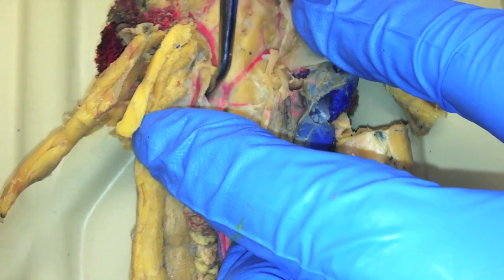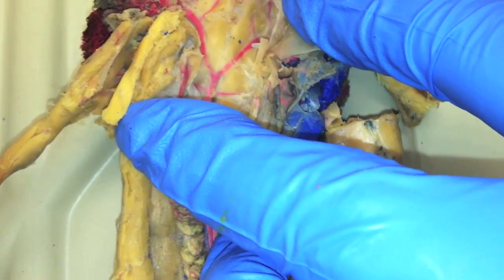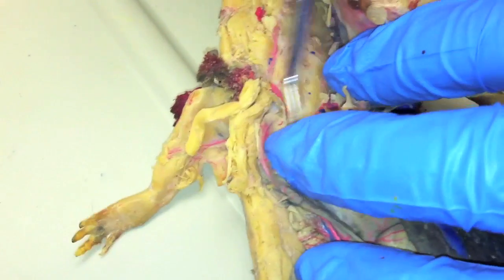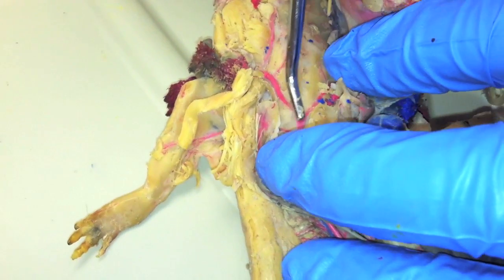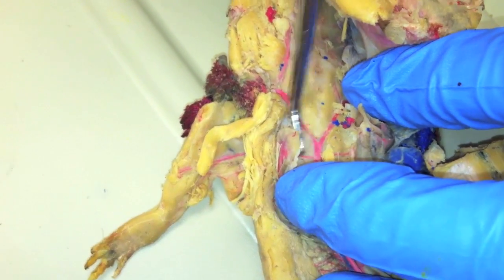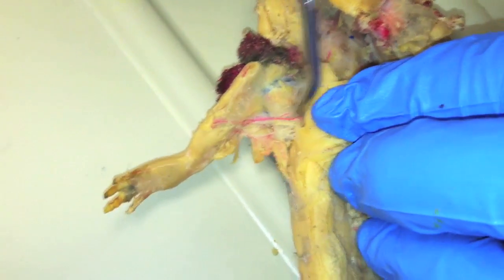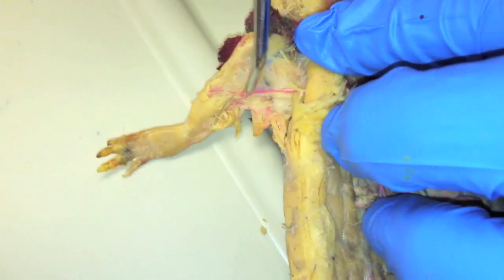There's both subclavian right there. With the arm of the mud puppy we have our subclavian, off the dorsal aorta, coming down, still in the arm, and the branch up is the cutaneous.